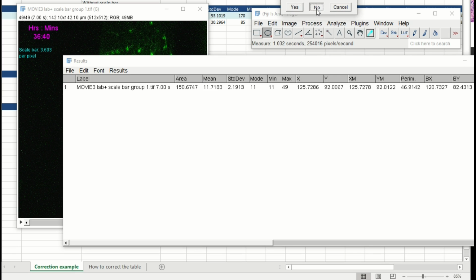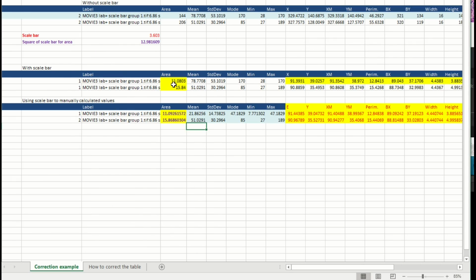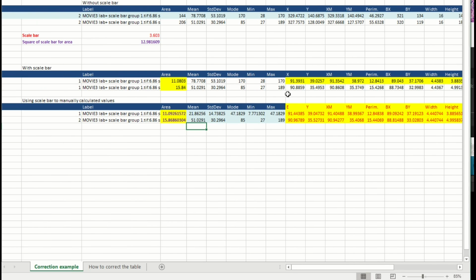In yellow, I show you in this Excel table the ones that are affected. So the area, and all of these ones, but the angle is not going to be modified, and many of them are not modified. There are two mainly that are modified in two different ways.